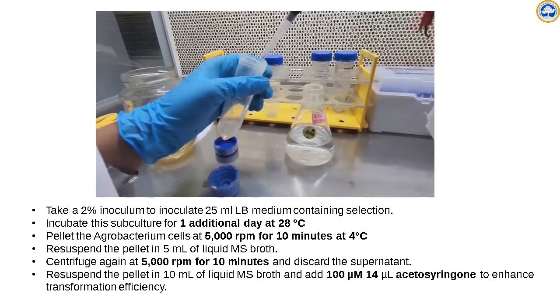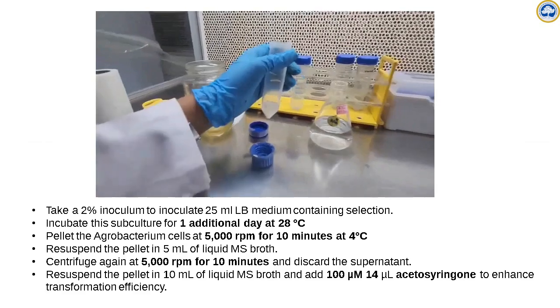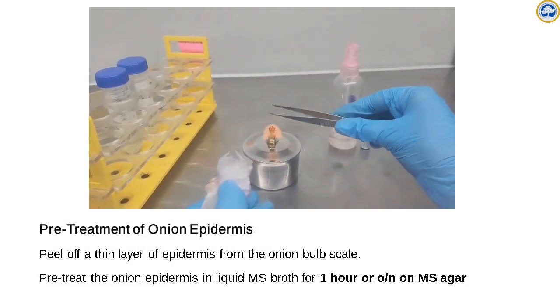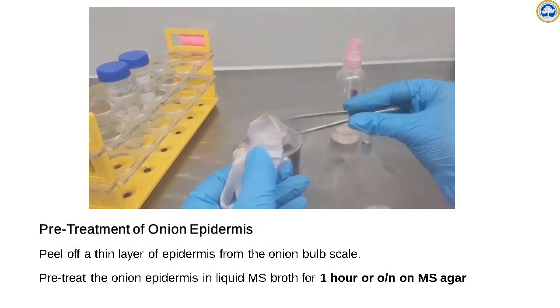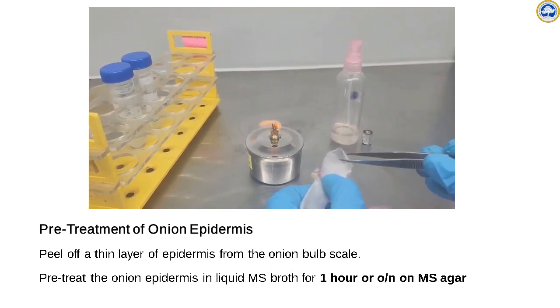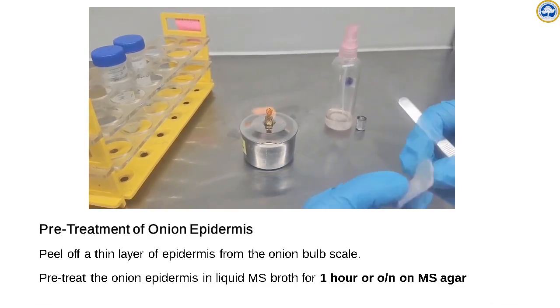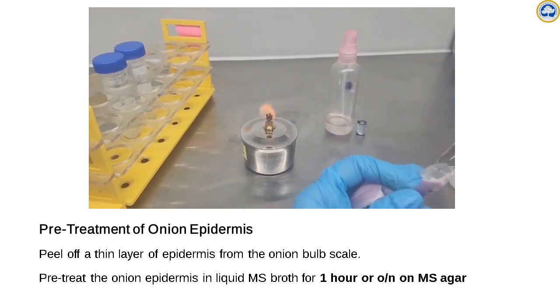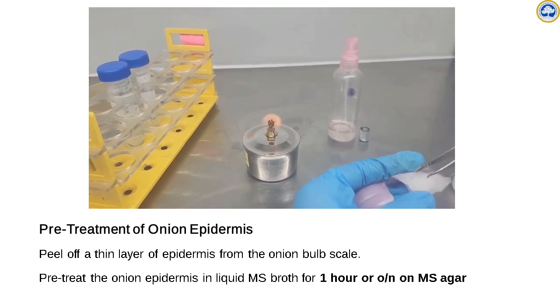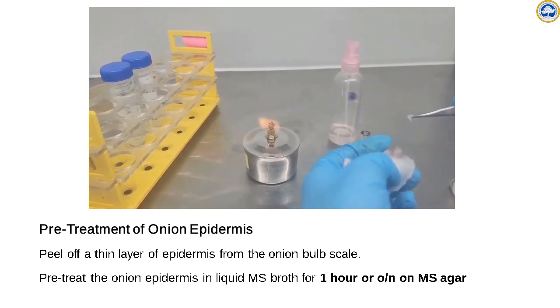Acetosyringone is a phenolic compound. It acts as a chemotactic agent which initiates the agro-infection process. The preparation of onion epidermal cells is done after surface sterilization. The onion scales are cut and the epidermal cells are removed from these scales. The removed onion epidermis is then incubated in MS broth or media, for 1 hour or even overnight.